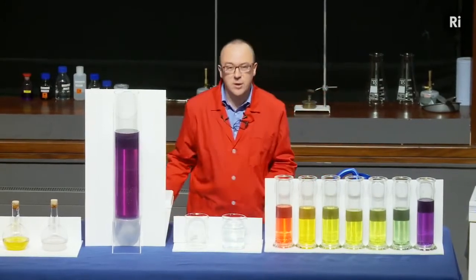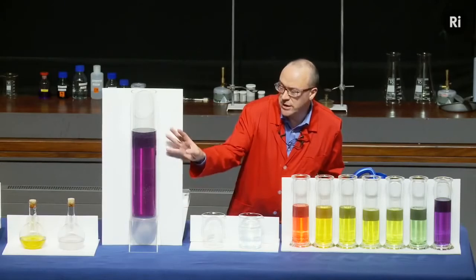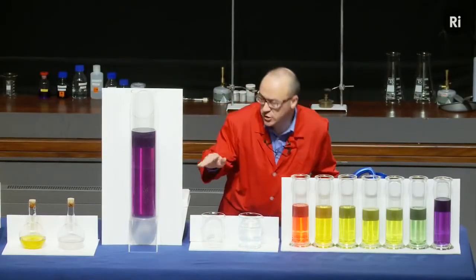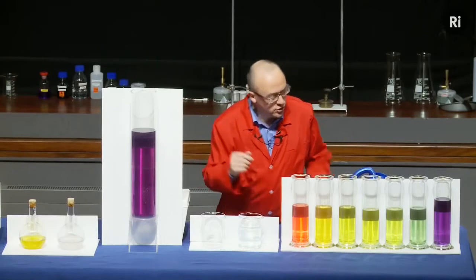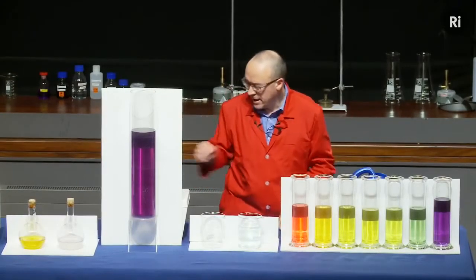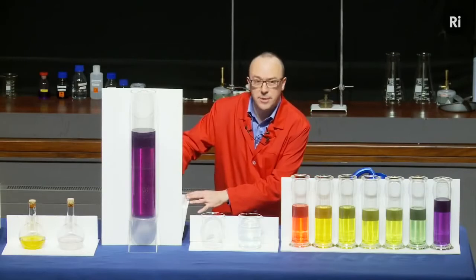But let me just show you now another example of a reaction involving universal indicator, and it's this column of water which has universal indicator and also a little bit of sodium hydroxide, which is alkaline, and so it's turned it this sort of bluey purple colour. I'm going to add some acid, and we should see it go through a sequence of colours rather like these. Now, the particular acid that I'm going to use is acid that's going to be made in the water from carbon dioxide.